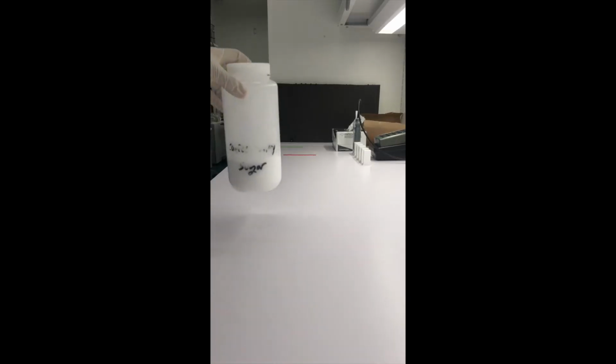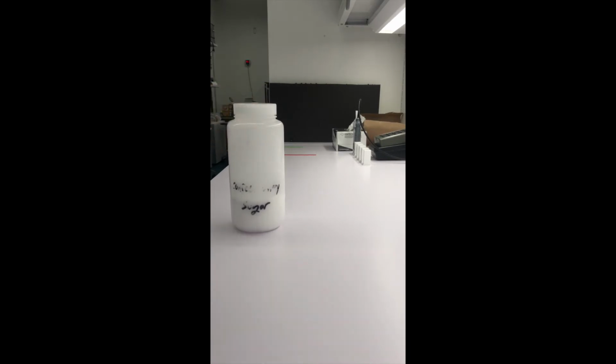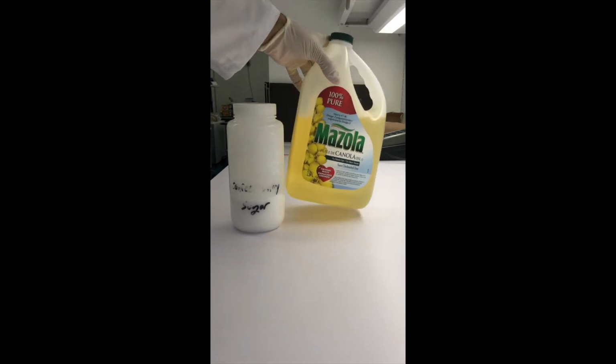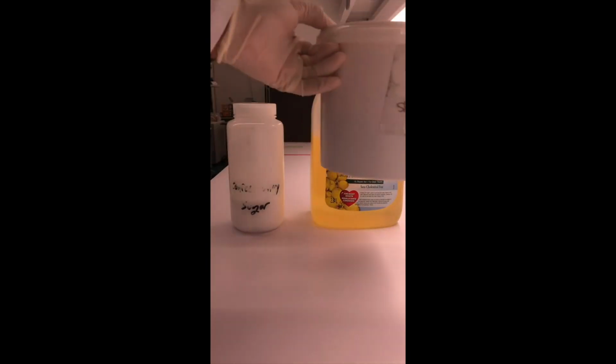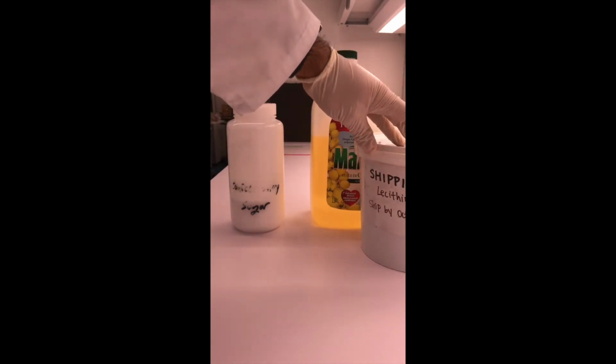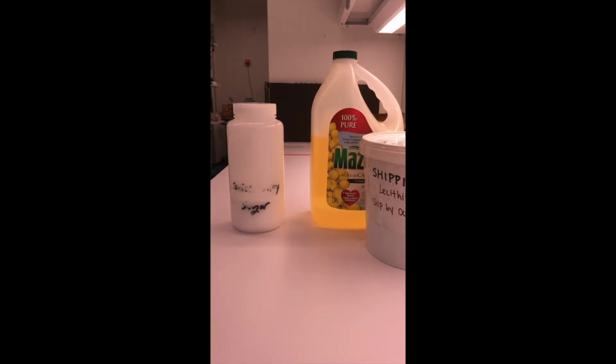Okay, and so now I'm just going to go through the process of preparing my samples so I can image them. And so here, one of the products that I need is going to be some confectionery sugar, as well as some canola oil. So this was just simply purchased from the store. I also have some lecithin, which is an emulsifier, so that I can add that to my samples. And of course, because I'm investigating the effects of water, I'm also going to use a little bit of water so that I can formulate my samples.